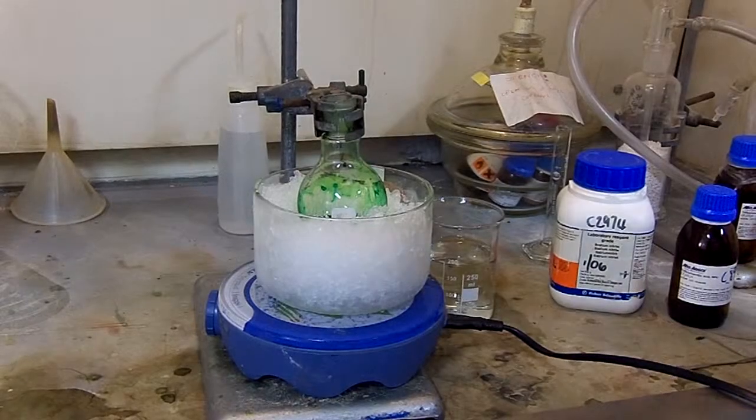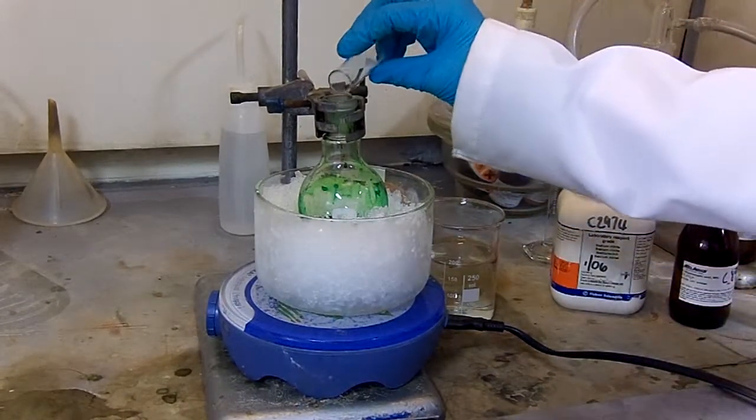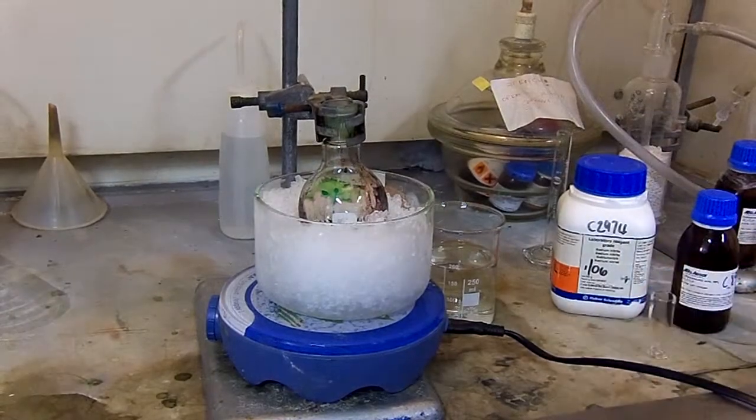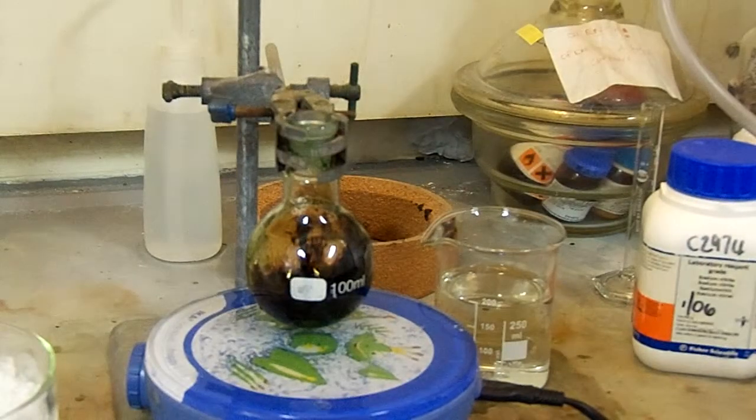Once your reaction mixture has completely cooled, add your carefully weighed out sodium nitrite to the reaction mixture and immediately remove it from the ice bath. This will need to then stir for exactly 4 minutes.